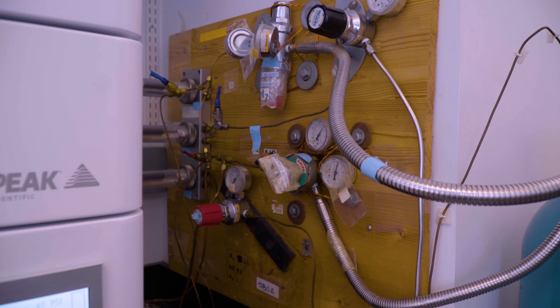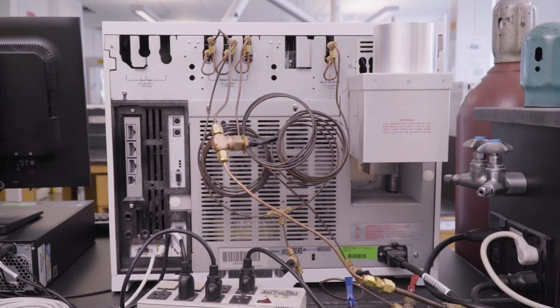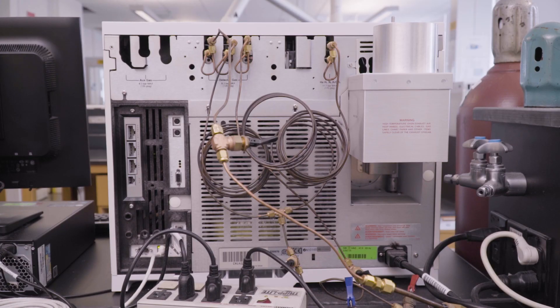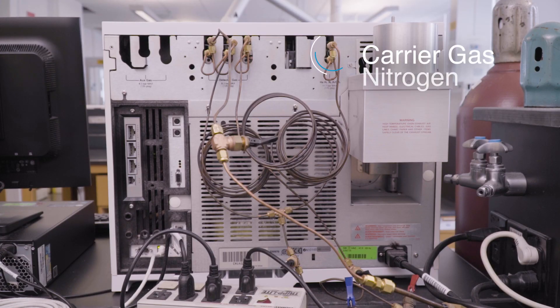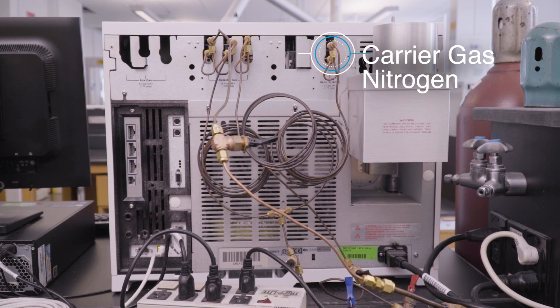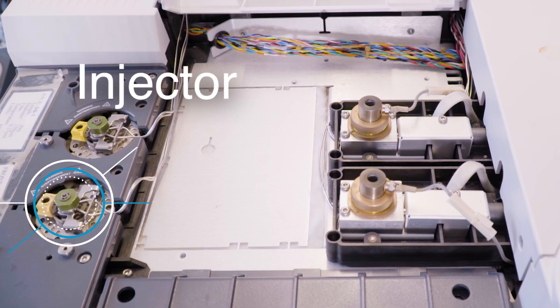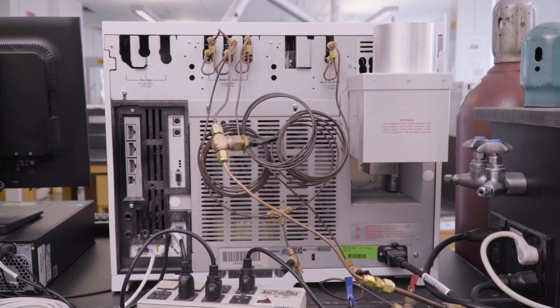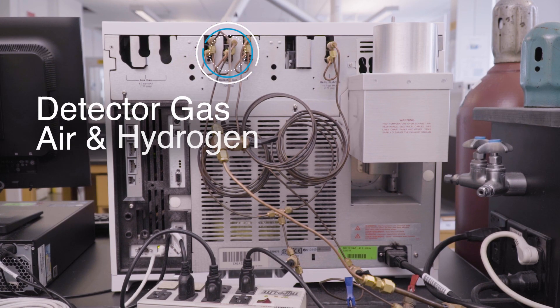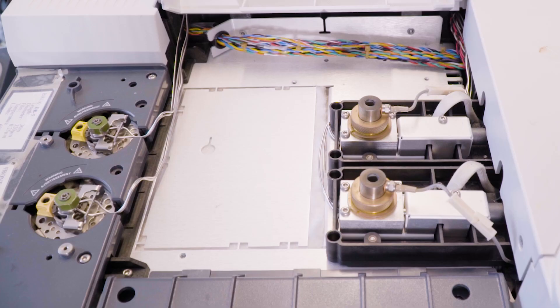These gases travel through the tubing and reach the GC instrument. The nitrogen, acting as the carrier gas, is connected to the injector, while the air and hydrogen are connected to the FID detector.